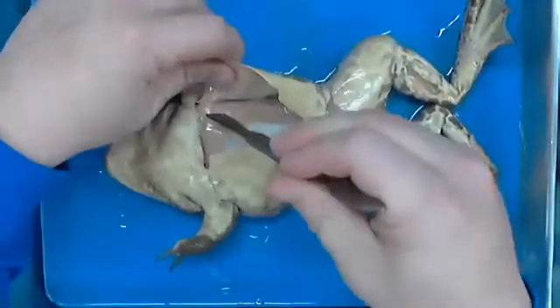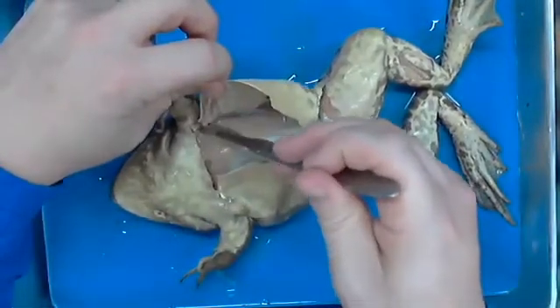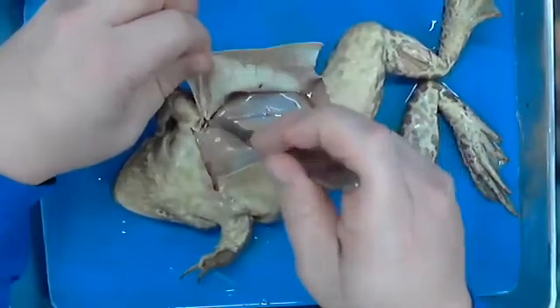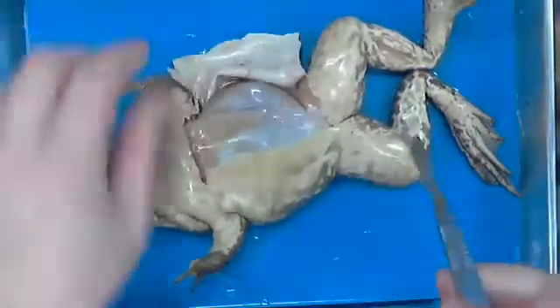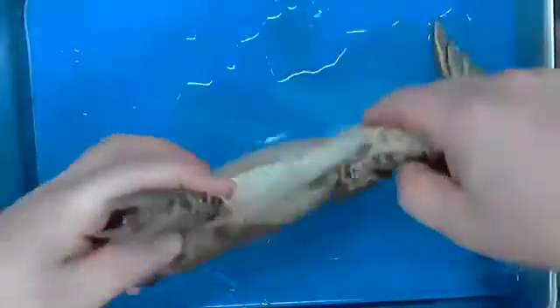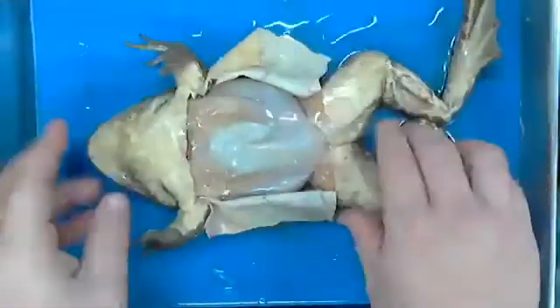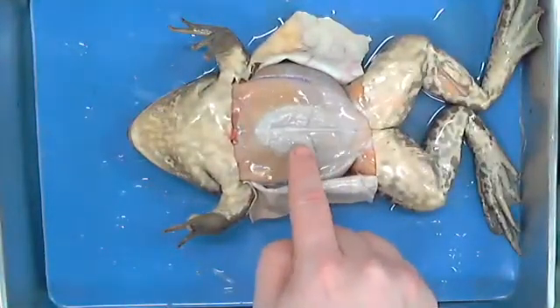And so kind of keep that in your mind as far as why on earth we would do it the way we're doing it. I'm going to get this stuff out of the way real quick, and then that will be all free there for us to not have to worry about again. All right, so let me clear him out because he is obviously filled at this point in time with lots and lots of formalin so that you have the ability to see. All right, so what would this be? Right here.